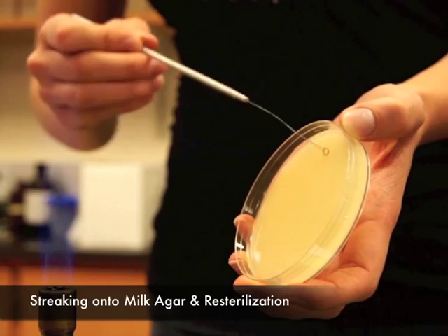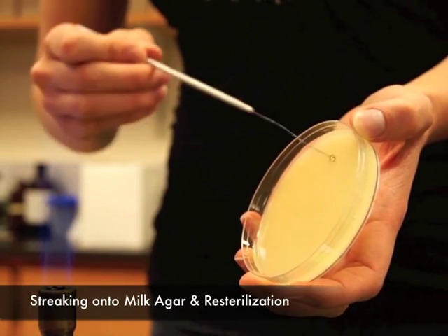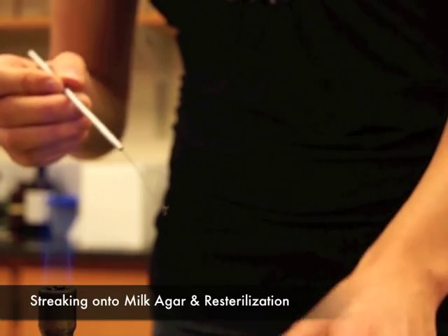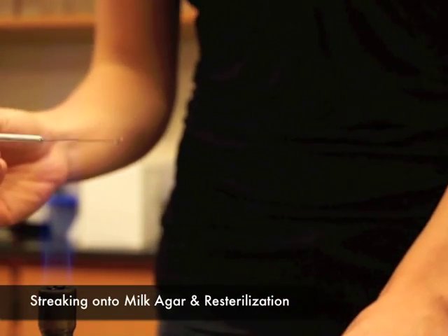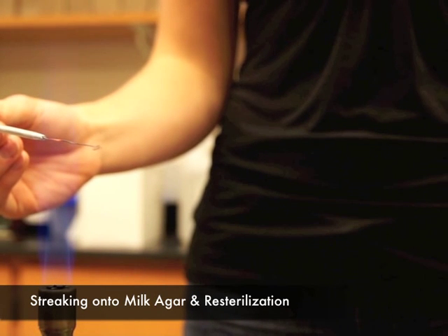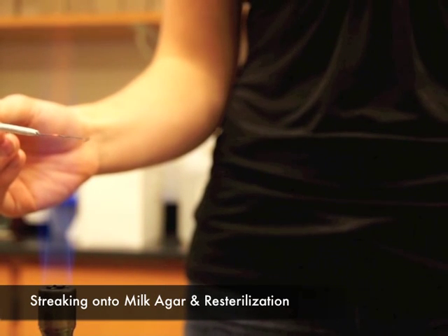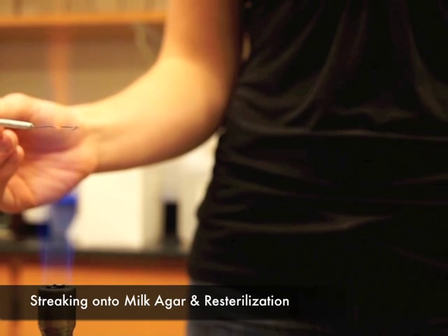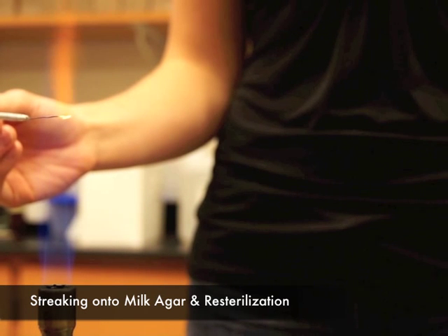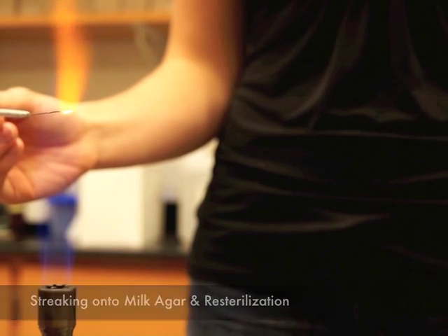Sterilize the loop when finished and turn off the Bunsen burner. Incubate the milk agar plate at 25 degrees Celsius for 17 hours. Be sure to label the plates appropriately.